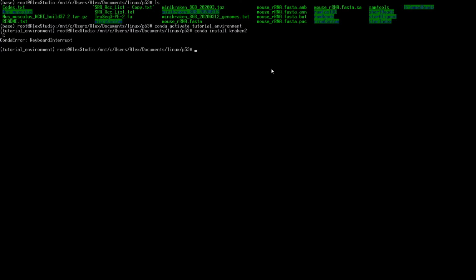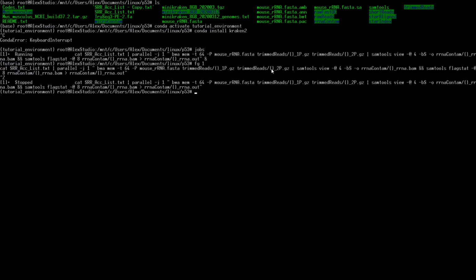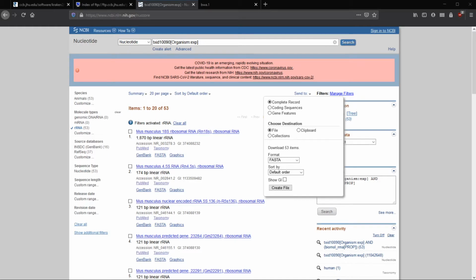Right now I have a job running, but I don't want that to keep popping up. Okay. Now, since we have BWA and Kraken installed, let's go back to Firefox.